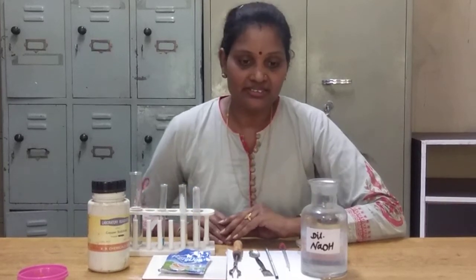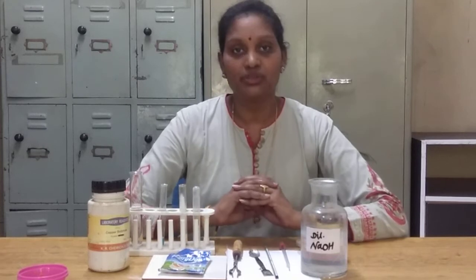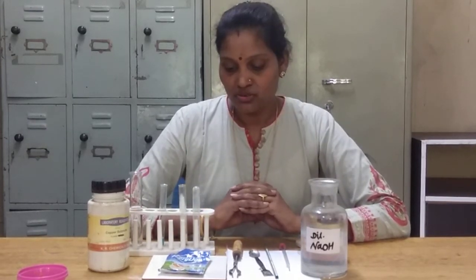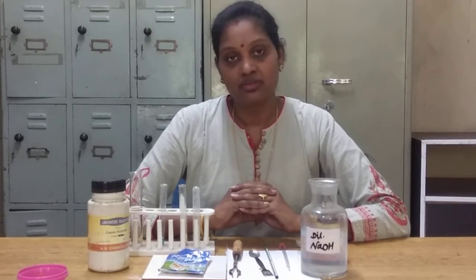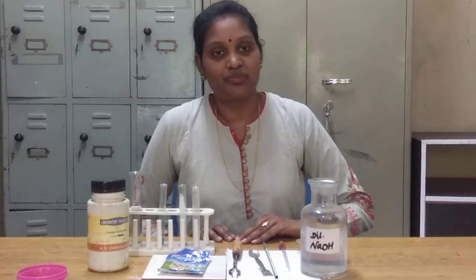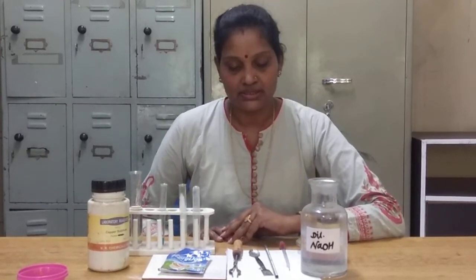Good morning students. Today we will see the activity of lesson number 2, components of food. The activity is based on the test for the presence of proteins. Yesterday we have seen the presence of carbohydrates, and today we will see the presence of proteins.